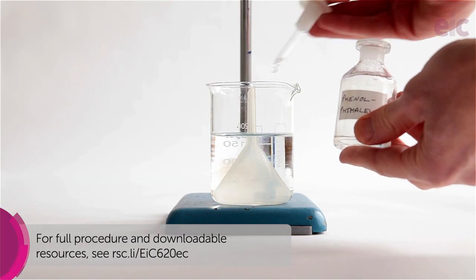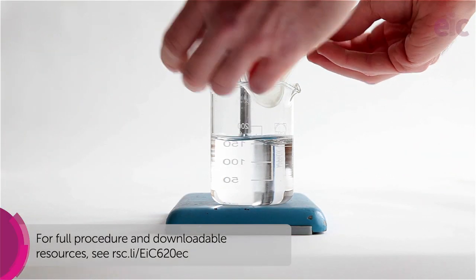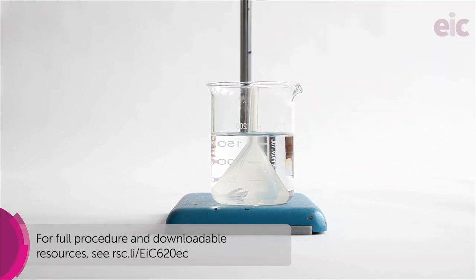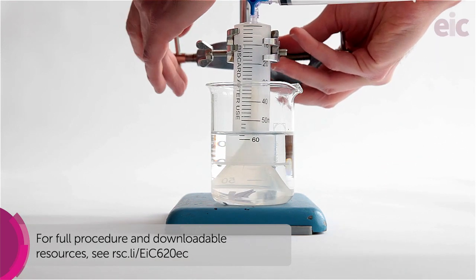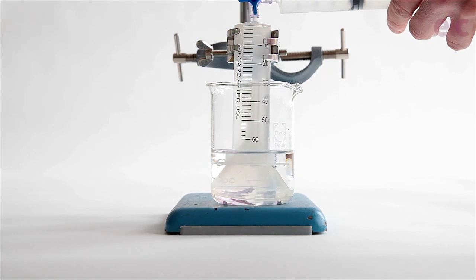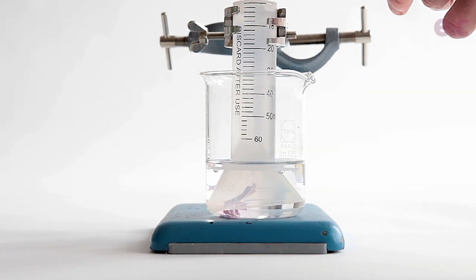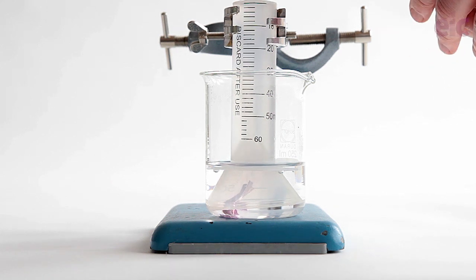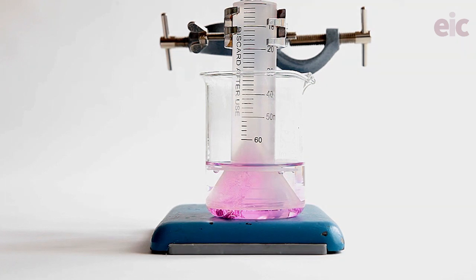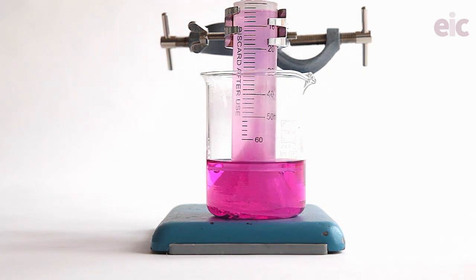So if you leave magnesium for a period of time, you can actually collect some hydrogen gas off of this, but you can see the reaction that I'm showing here was collected over about a 24-hour period. We were able to produce a sensible amount of hydrogen that we could then burn off. You can see the phenolphthalein also there changing color, indicating that we're producing some hydroxide ions in the solution as well.